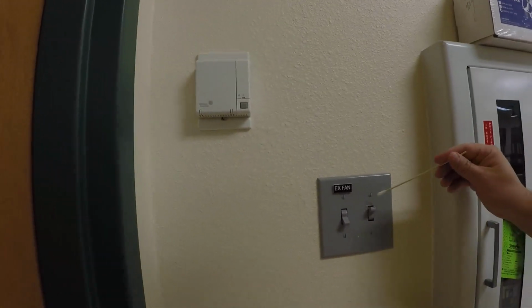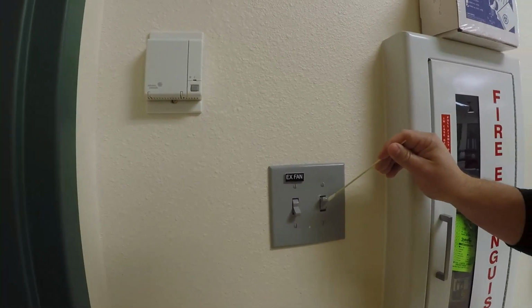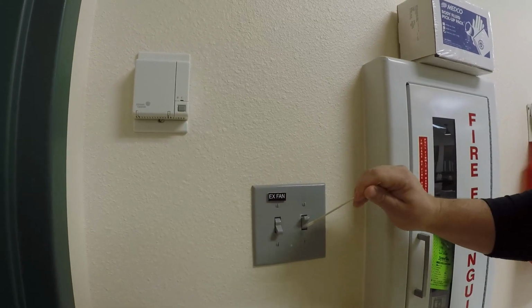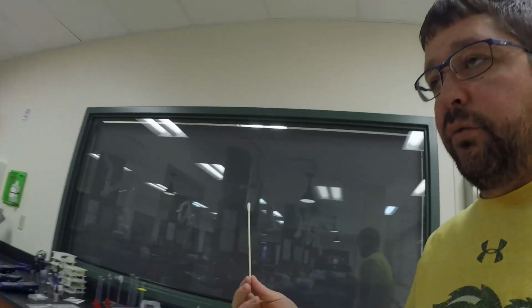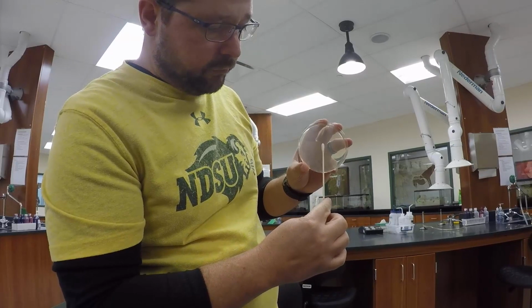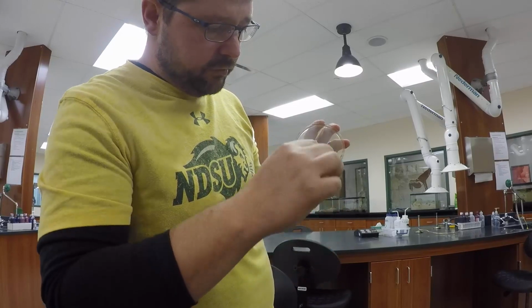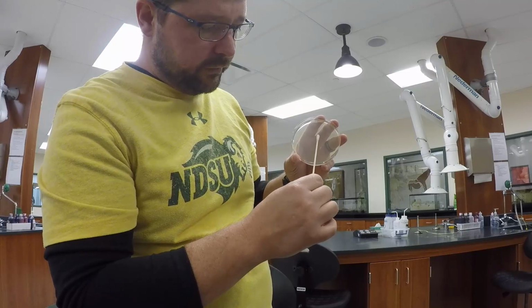So this is wet, and now I'm just going to swab, maybe I'm going to swab a light switch. Okay, so this is a light switch, so I'm going to swab the top of the light switch, rolling the cotton swab around, and I'm going to swab the inside, outside, and bottom of this light switch. Okay. Now I have bacteria from that light switch on this cotton swab. I have the Petri dish right here. So I'm going to open it up, and then I'm just going to twist that and spin that around in the center of the dish, making sure that I got all the sides collected and good to go.